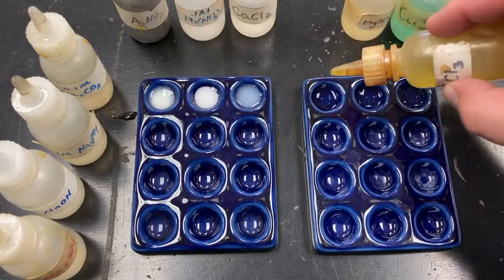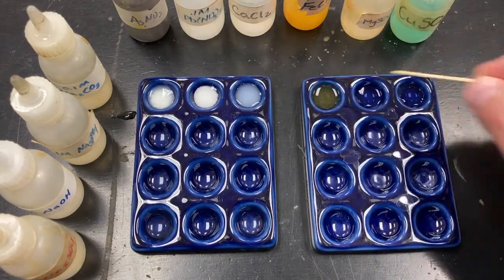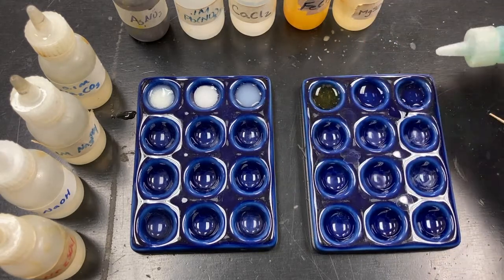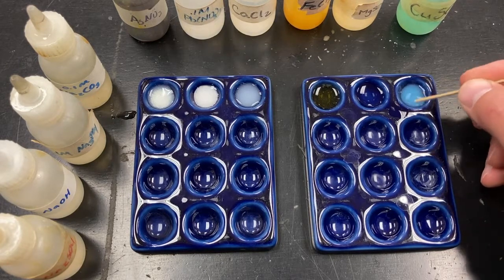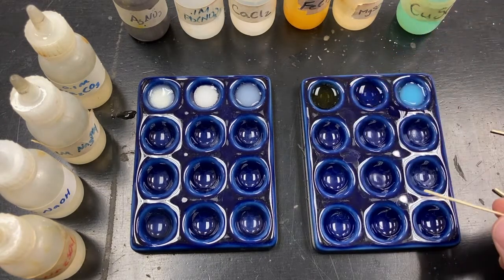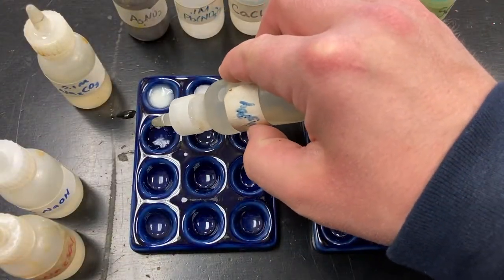Well, we're going to use iron chloride. Oh, we see something different now. Okay. Magnesium sulfate. I don't see anything there. And copper sulfate. Okay, so there's another very faint, almost a powder blue solid. Powder blue, very fine solid. Okay. And the iron chloride formed a red solid. Okay, let's move on to sodium phosphate. We'll do every square or every cell.